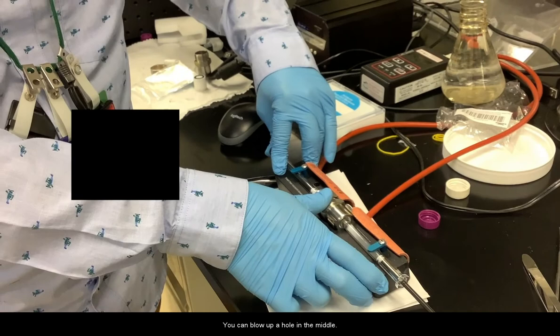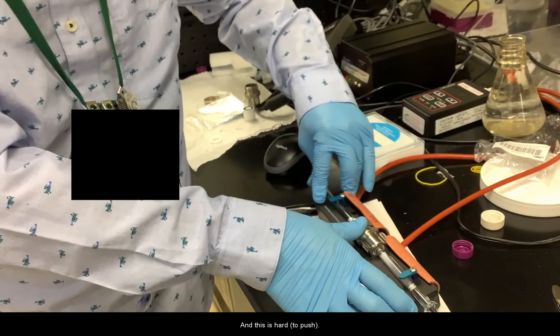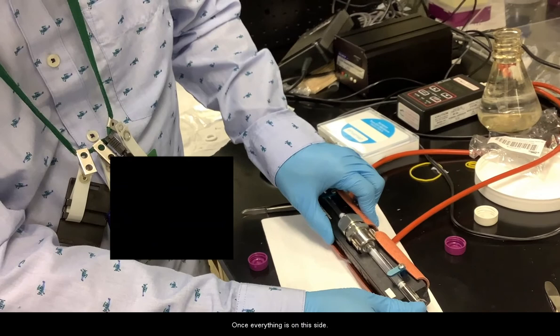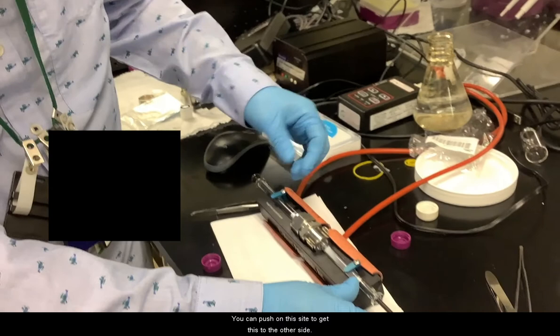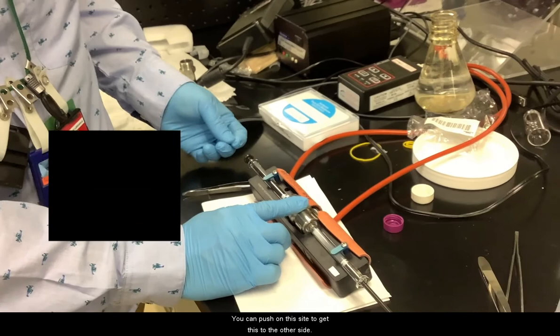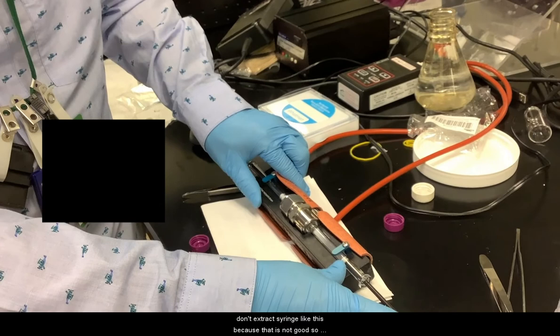It's hard actually. It's hard to push sometimes. Once everything's on this side, you can push on this side to get this to the other side. Don't extract the syringe like this because that is not good. Only use push motion.